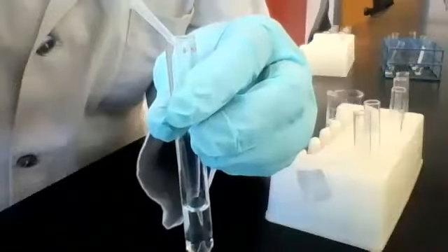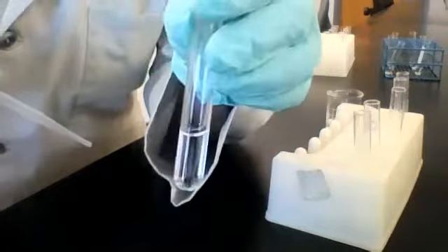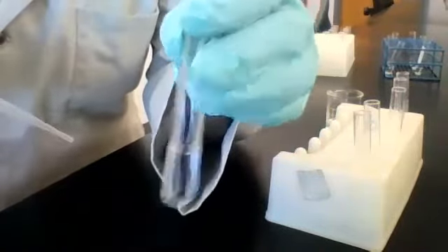Exactly, it should stay the same. They have an ion in common, so even if they do a double displacement reaction, the combination of ions is still the same. Look, we were correct. No visible change.